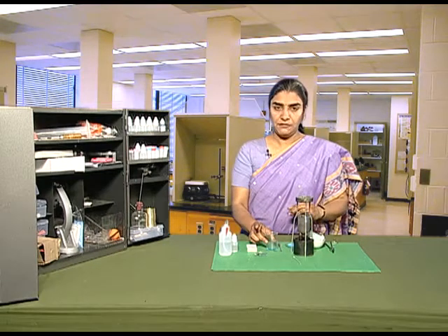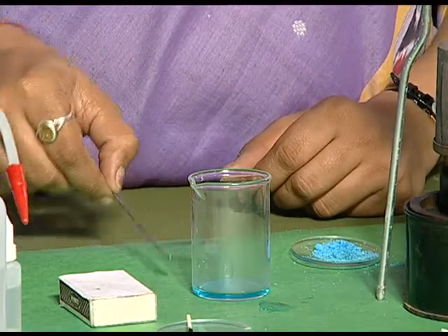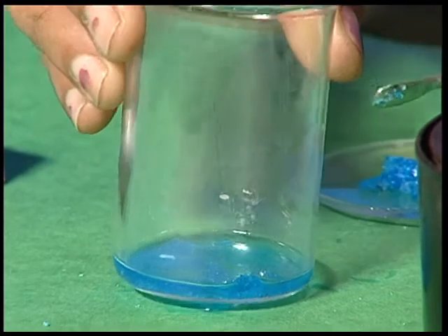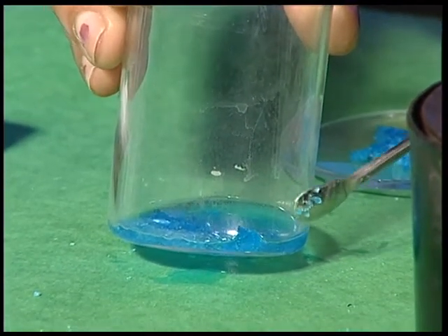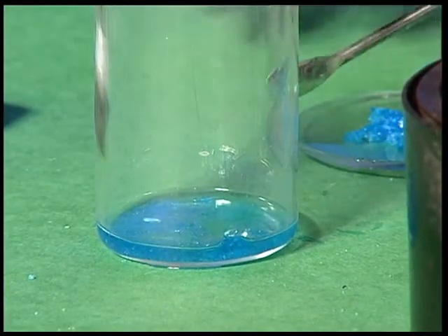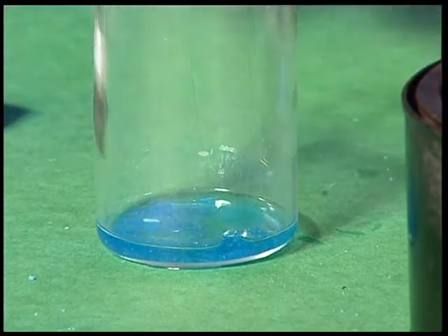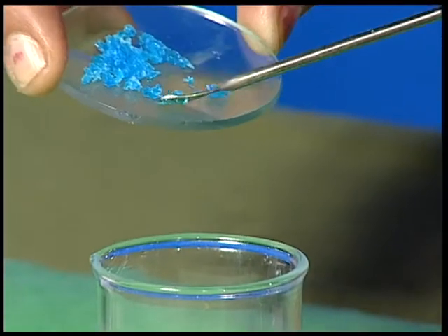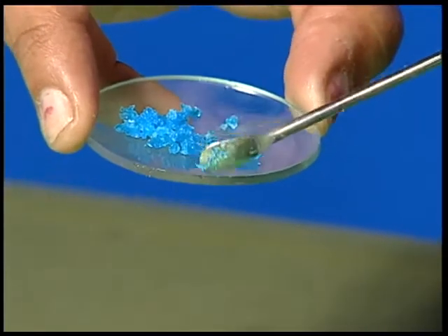Leave the solution of copper sulphate undisturbed for some time. After some time, we will observe crystals of copper sulphate appearing at the bottom of the beaker. Let the solution dry properly and after that we can obtain clear crystals of copper sulphate.